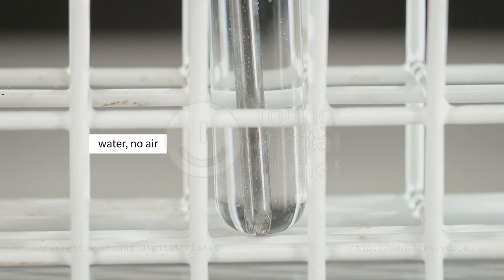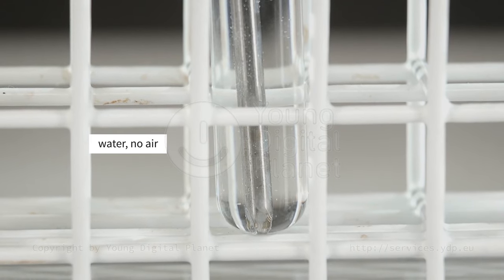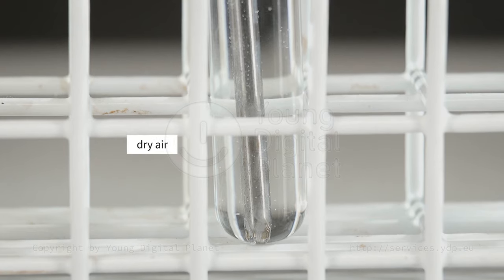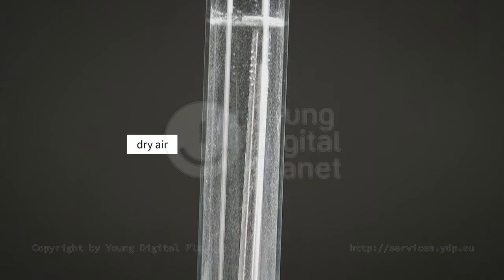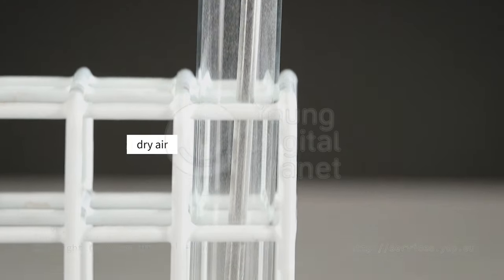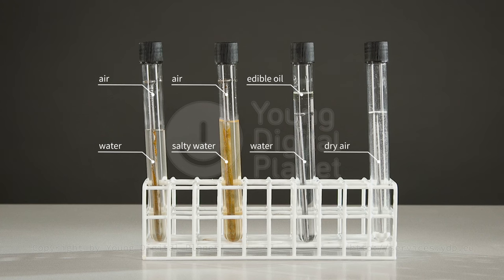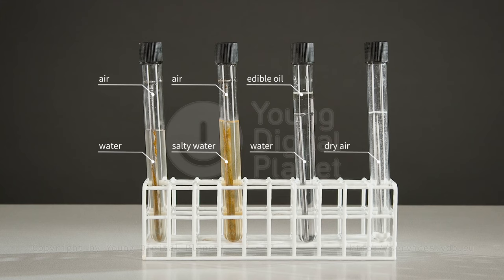In the third test tube, the nail was in contact with water, but there was no access for air. In the fourth test tube, there was no water. It appears that both air and water are needed for rusting to occur.